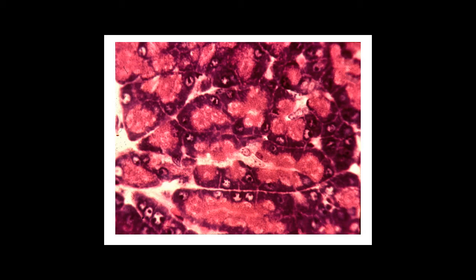Now the basophilia, the dark blue staining, is due to the fact that there's a tremendous amount of rough ER in these cells which are actively engaged in protein synthesis. The apical acidophilia is a result of the zymogen granules. These are, of course, the pancreatic digestive enzymes which are packaged into vesicles, and these vesicles are stored until the cell receives a signal for secretion. So the acinar cell is the prototypical example of a protein secretory cell that secretes by regulated secretion.